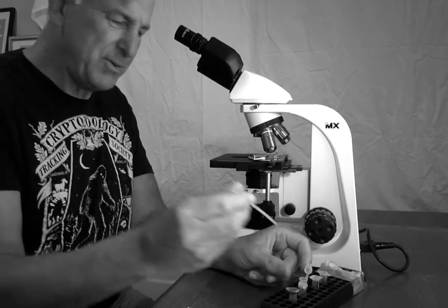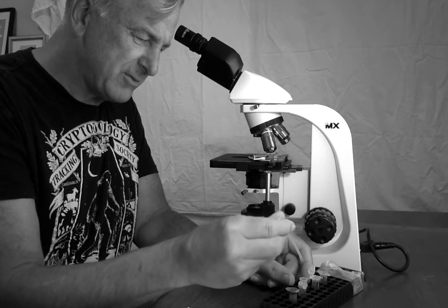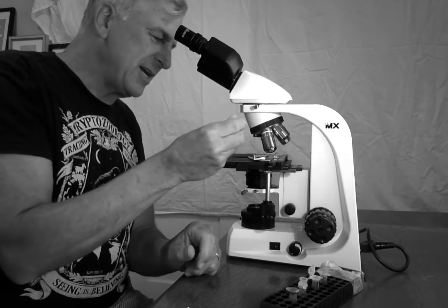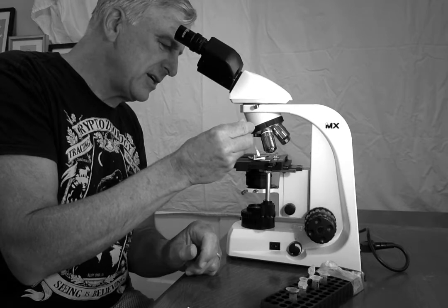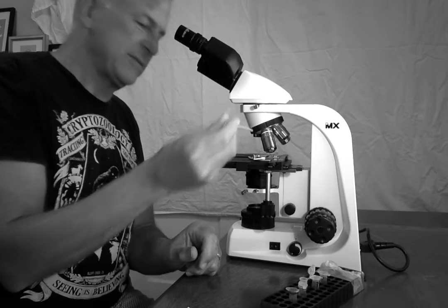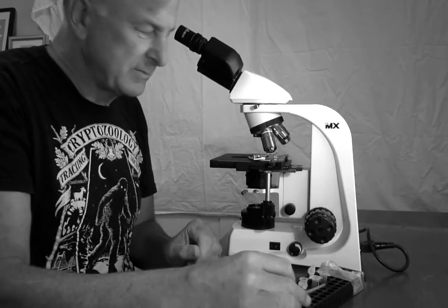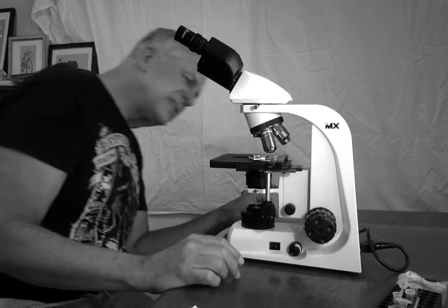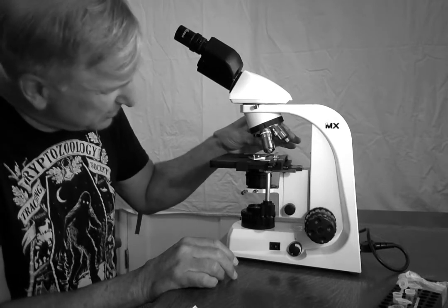I'm going to get a dropper. I'm going to get the approved oil. It's not 3-in-1 oil. It's the right oil for microscopes. And I am going to put one drop right over the illuminated area. That's all it should take. Then I'm going to carefully move the 100x objective into place.